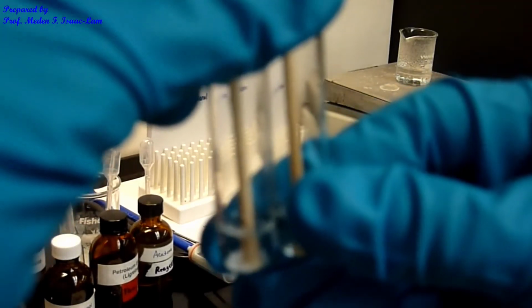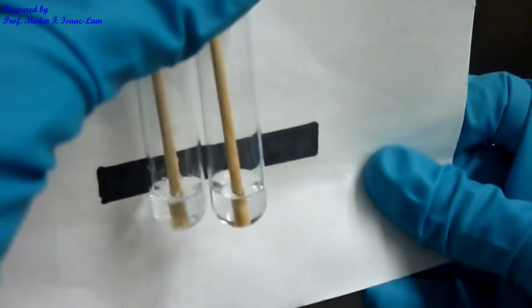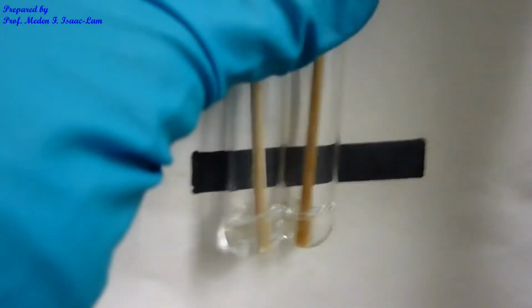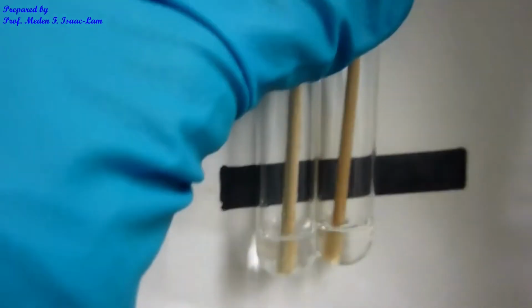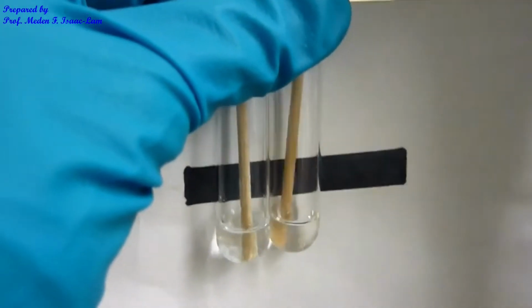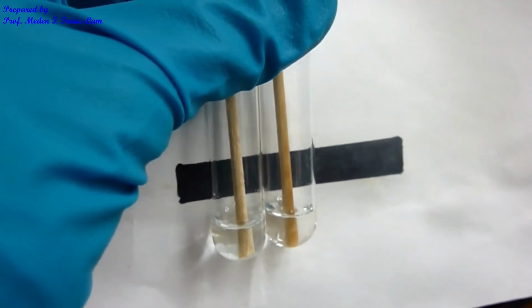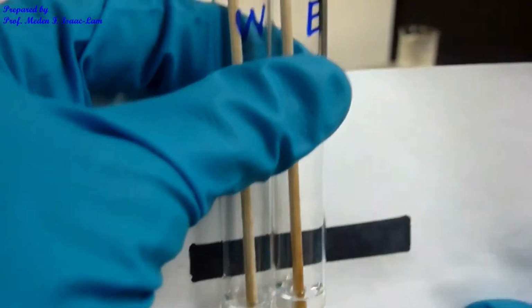So as you can see, if I have the card in here, the ethanol, you don't see the solid anymore. However, the water still has. So I have less of the solid for my water at room temperature. However, the ethanol is completely dissolved. So the sample is completely dissolved in ethanol, 95% ethanol at room temperature.